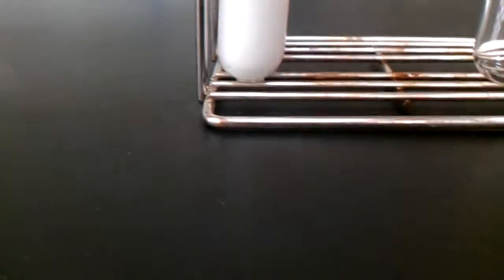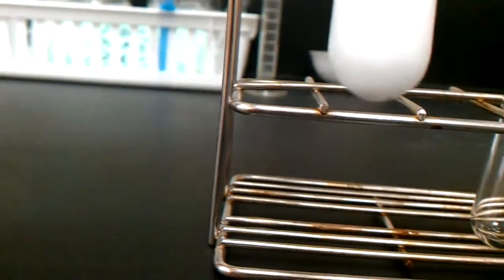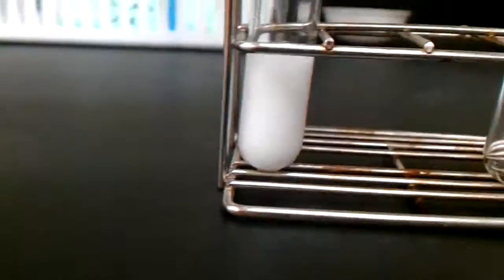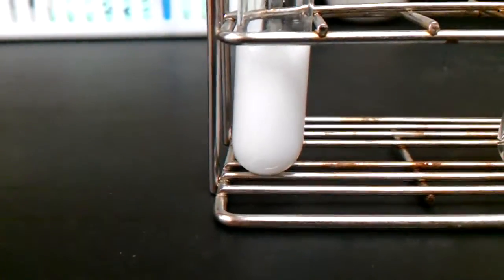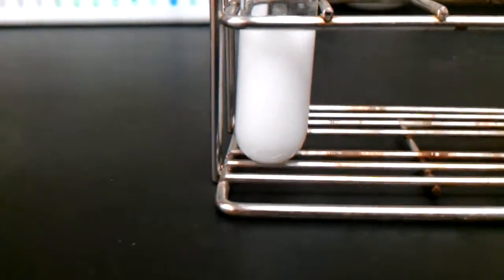All of the silver hydroxide has been converted to silver chloride, and that's a solid. It kind of looks like milk right now, but if I were to put it in a centrifuge, I would get a solid at the bottom and a clear solution on top.